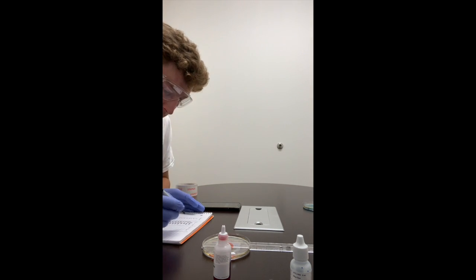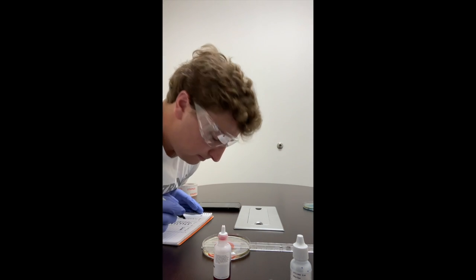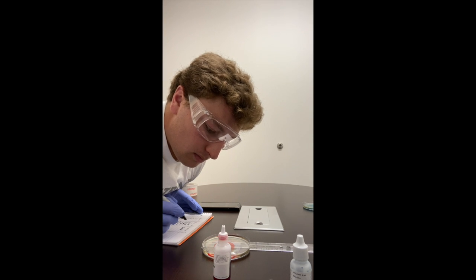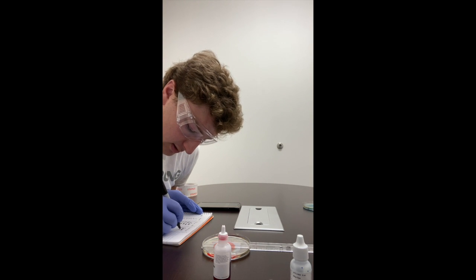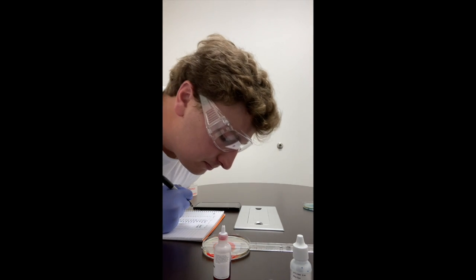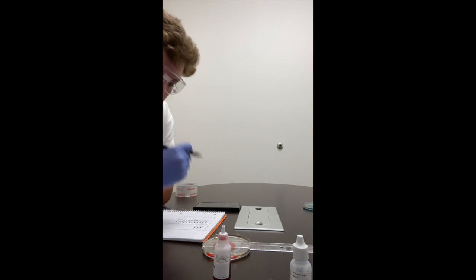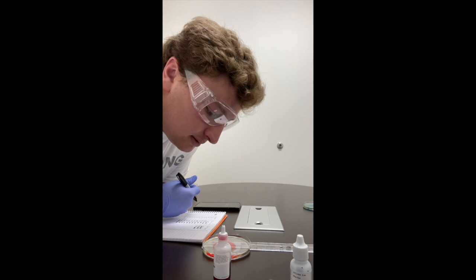So after 10 seconds, it's already at 6 centimeters. At 20 seconds, still at 6 centimeters. Still at 6 centimeters. At 30 seconds.